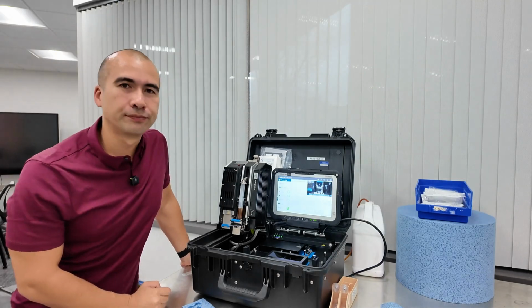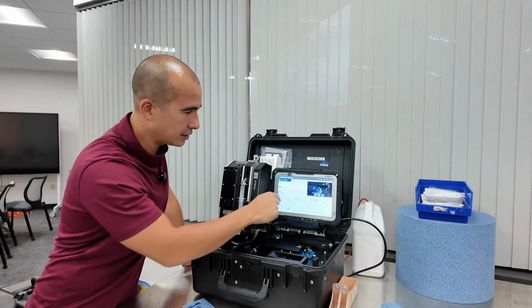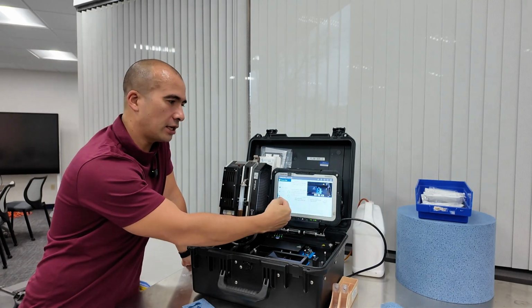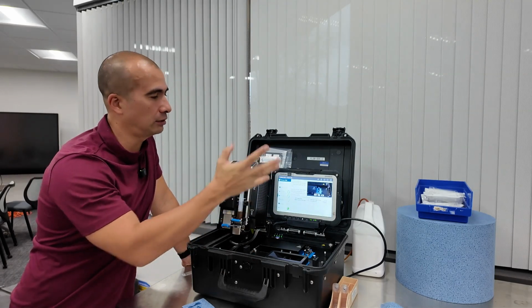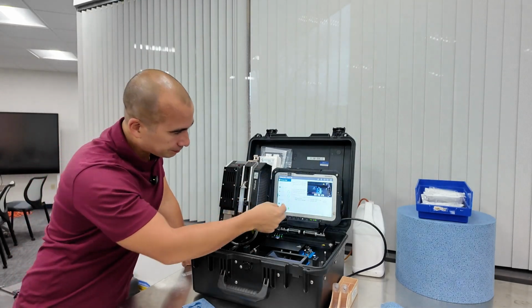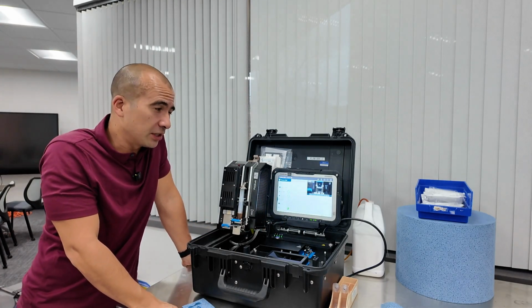Now while that's going, the infrared has already done, so we could actually go back here under chemistry, and it's going to give us total acid number, oxidation, as well as water. So most of the contamination as well as degradation is going to be covered by the infrared. In the meantime, particles is almost 70% done.